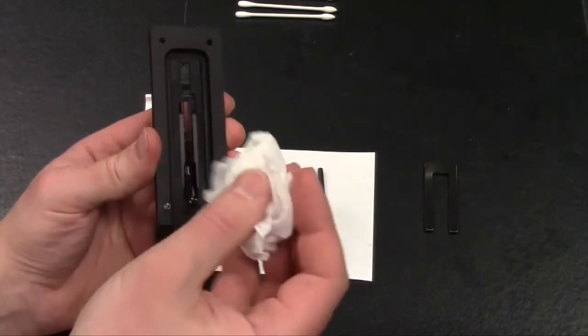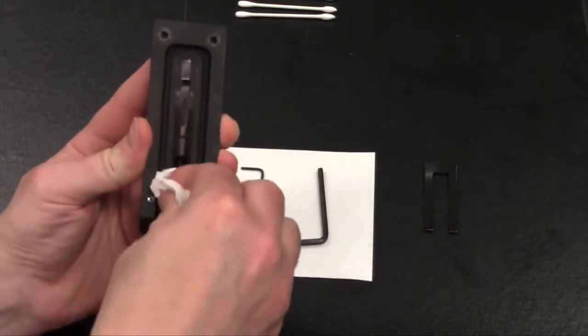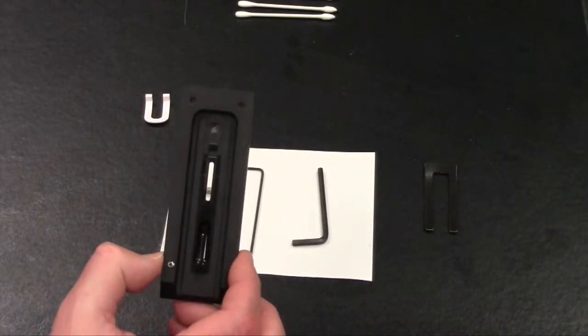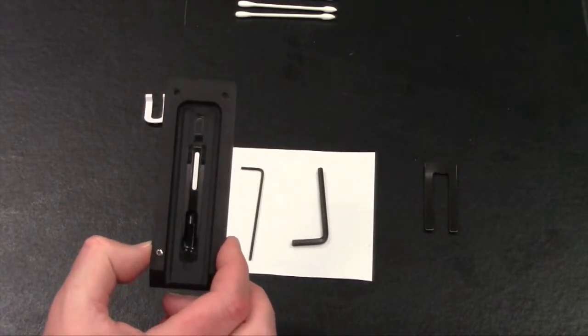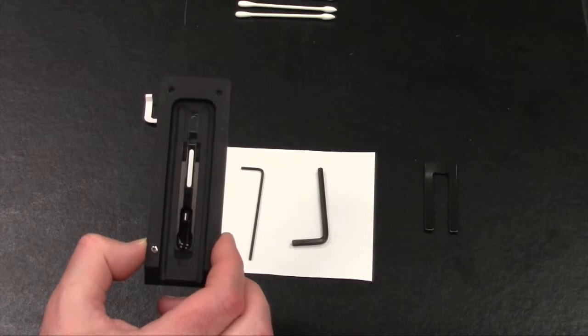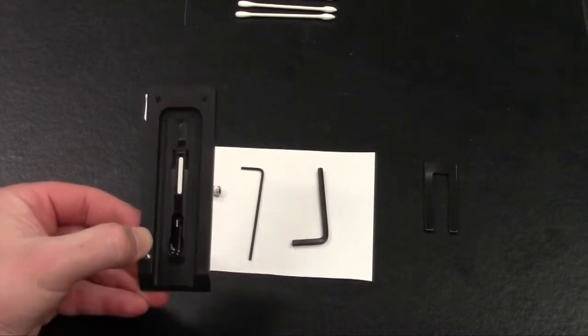If needed, you can use that same Kim wipe or lint-free towelette to clean. What you want to do is inspect the lens once you're done to make sure it looks clean and that there are no scratches or any other damage to the plastic lens itself. If you do see any scratches or damage that you cannot remove with the different cleaning towelettes, the next part of this video will show you how to remove the lens and replace it with the 2 lenses that are supplied with the Easy Cleaning Kit.